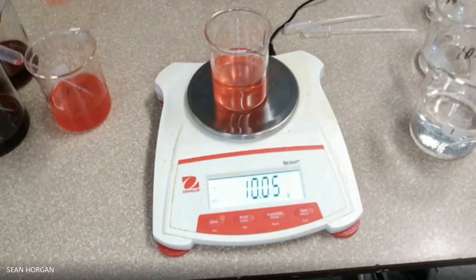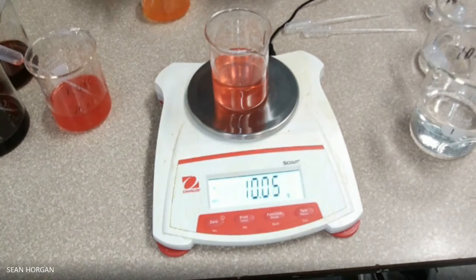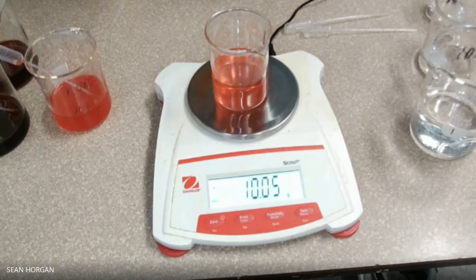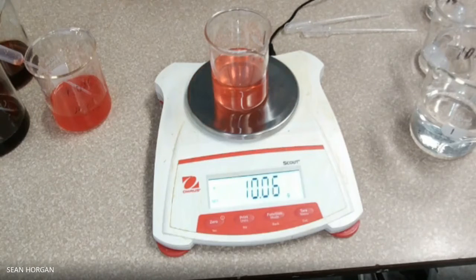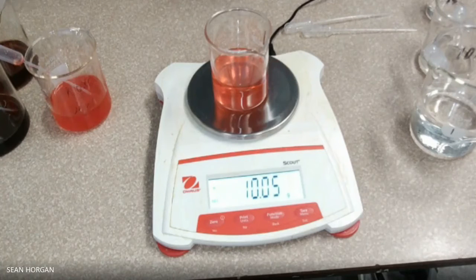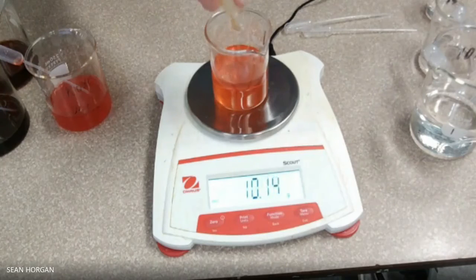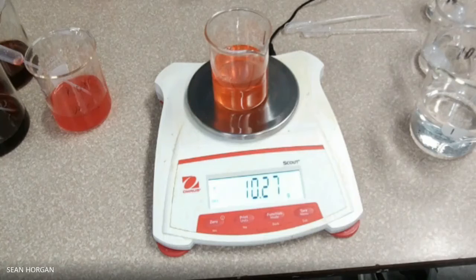The next one we're going to do is orange soda. We got ourselves some orange soda. We're going to tare it again and put the stuff in. Seems like a lot. 10.57.